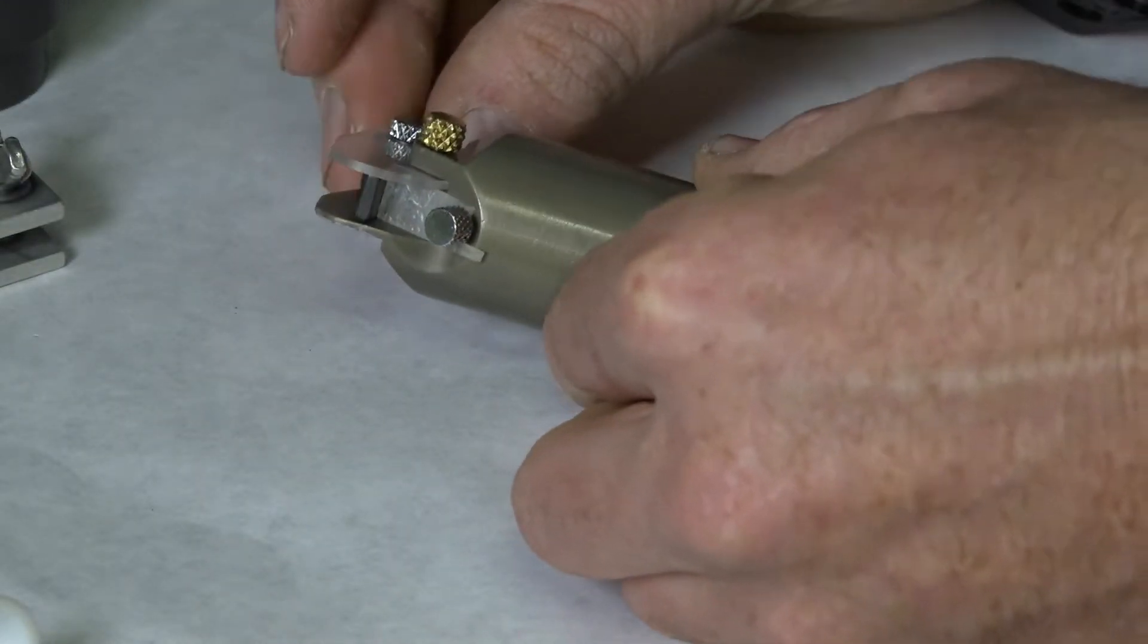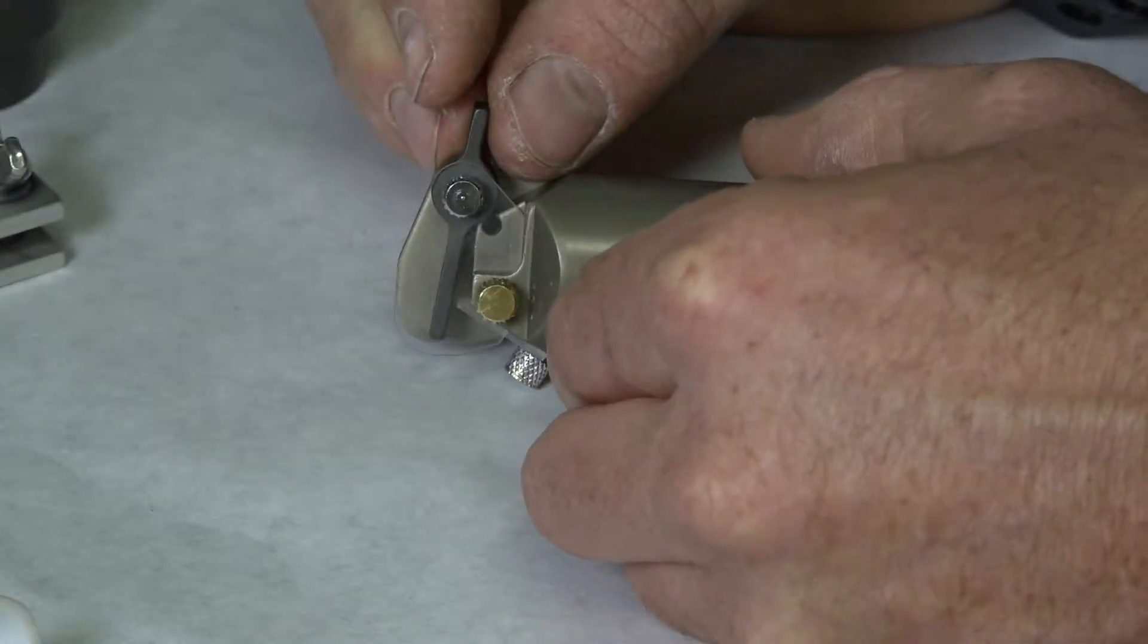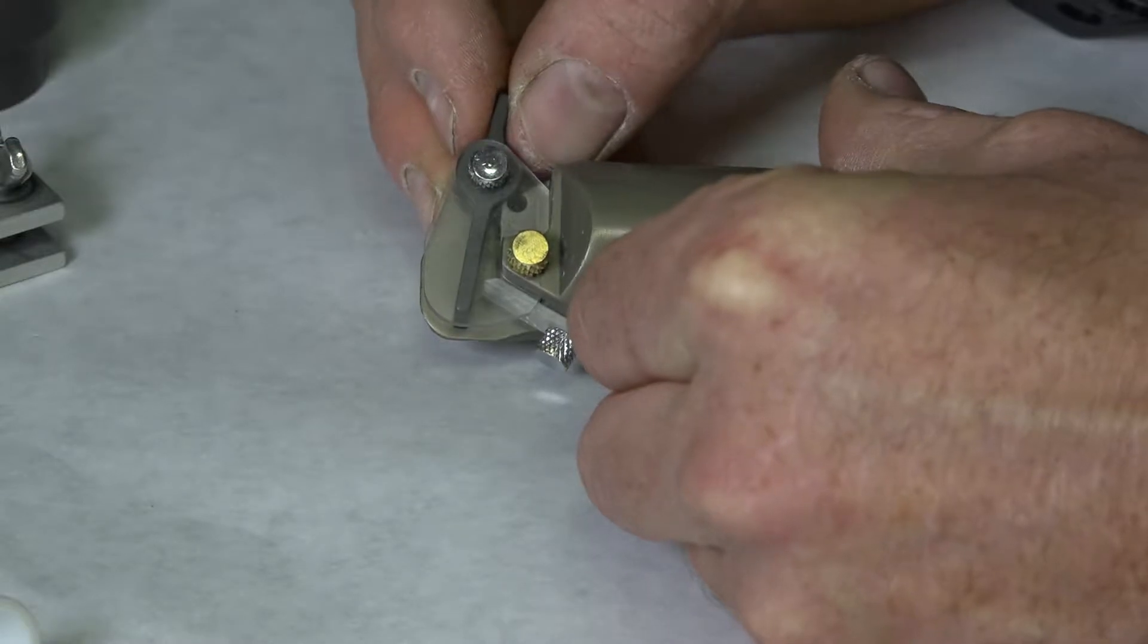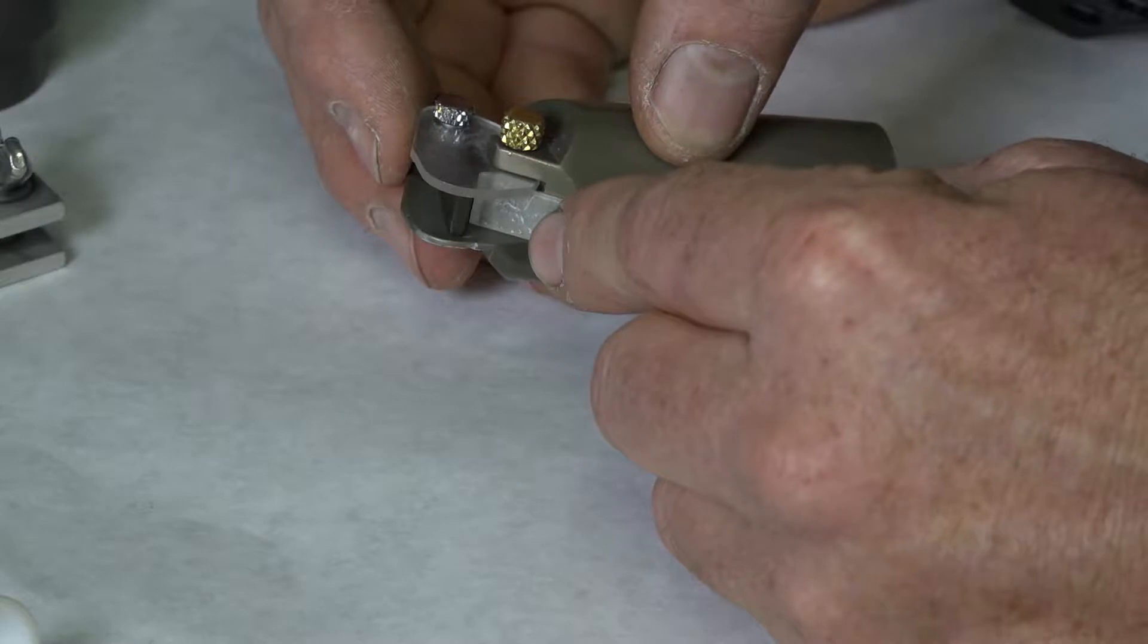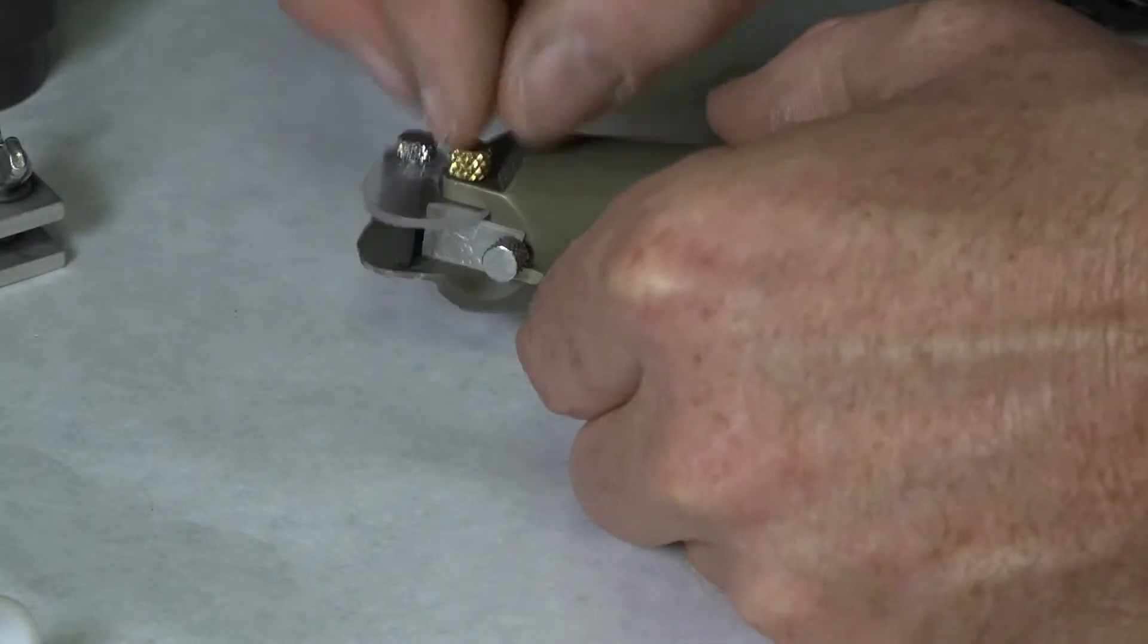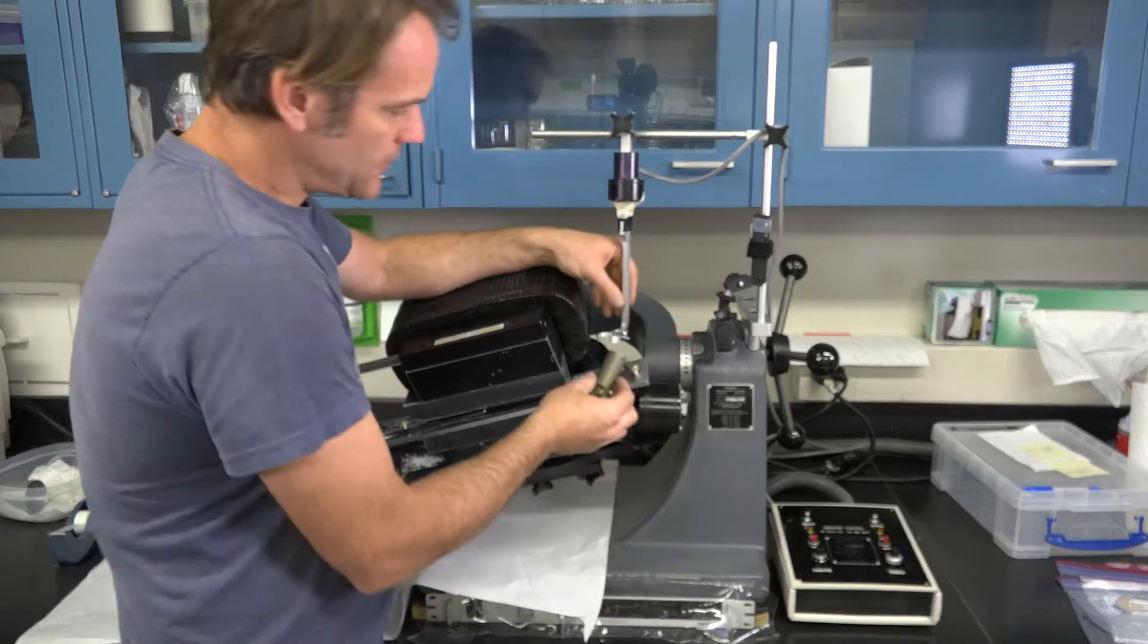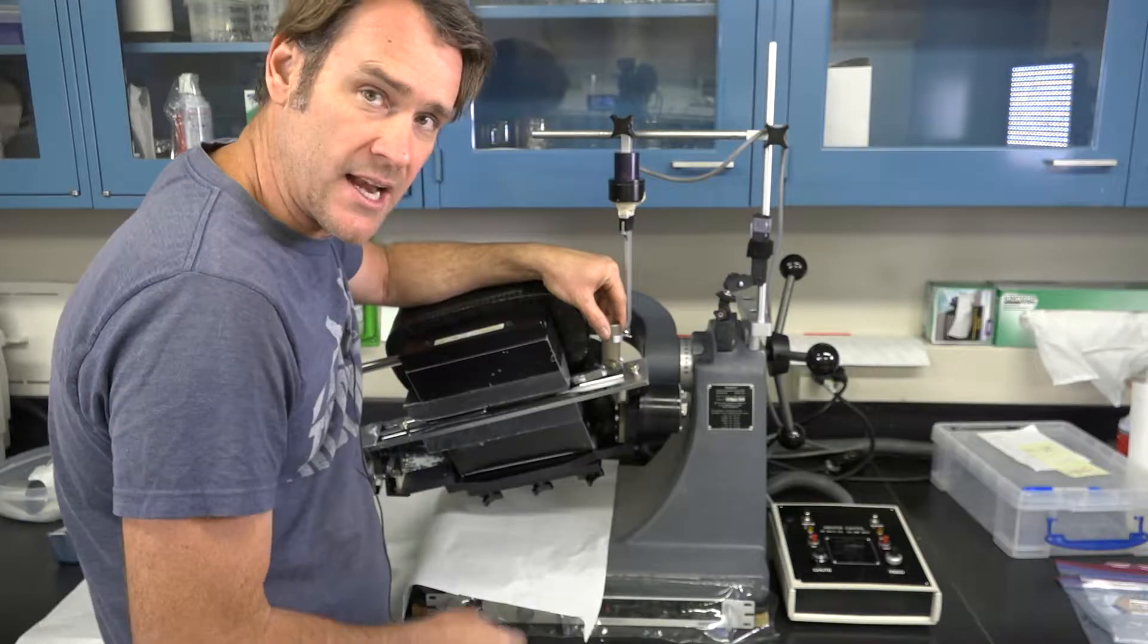You have a set screw that's basically chrome plated but it's still brass. Basically then you set that blocker in the front and pull your actual ramp down so there's about maybe a sixteenth of a gap. Right there in the front you want to make sure there's just about a sixteenth of a gap. Any bigger and your sample will be pouring out. When I say sixteenth of a gap, I mean sixteenth between this front barrier here and your dark anodized aluminum ramp. Make sure everything is as tight as you can get them and it's ready to install.